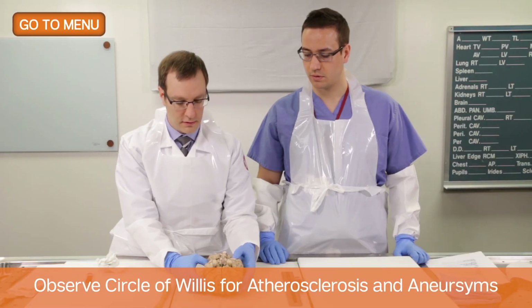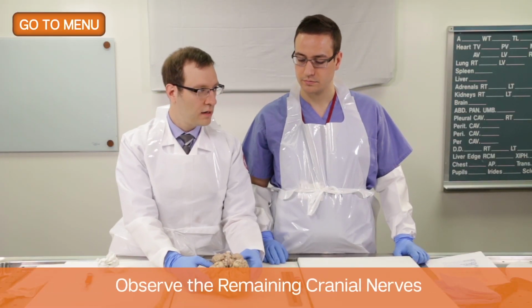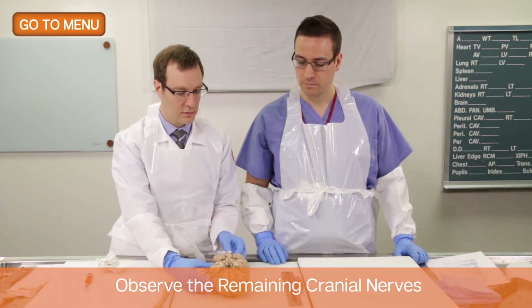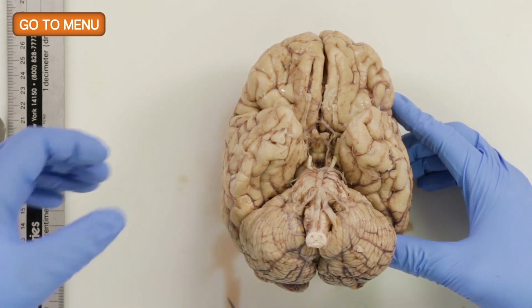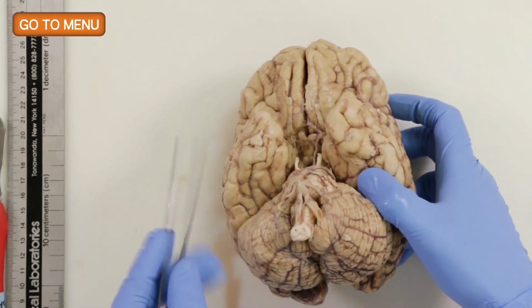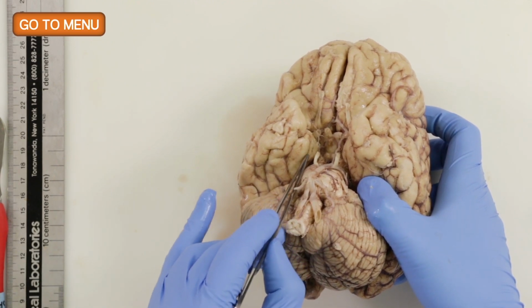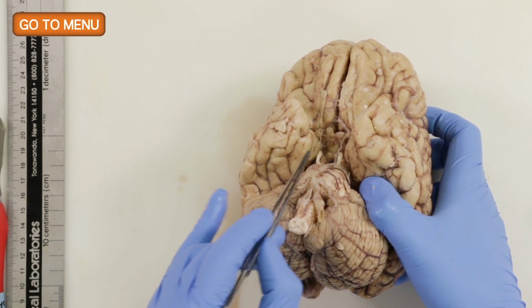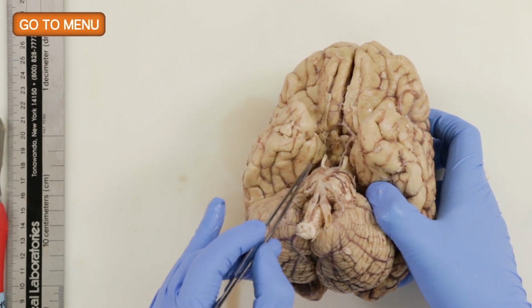The last thing we have to do is to look for evidence of herniations on the ventral side of the brain. So which two types of herniation would we be looking for? So we'll look up here for any signs of uncal herniation. That's right. So you want to look in the medial aspect here of the temporal lobe. You'll see a little notch here. That's where the medial aspect of the temporal lobe rests on the tentorium cerebelli.